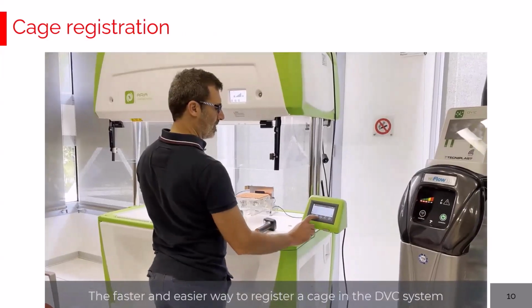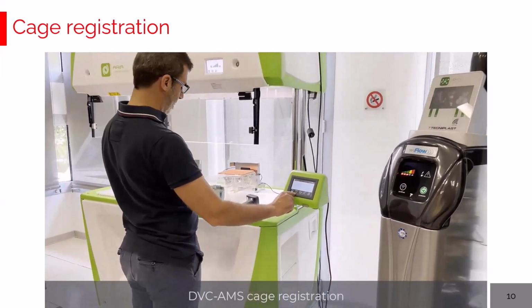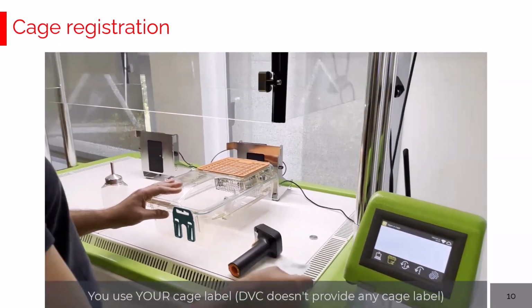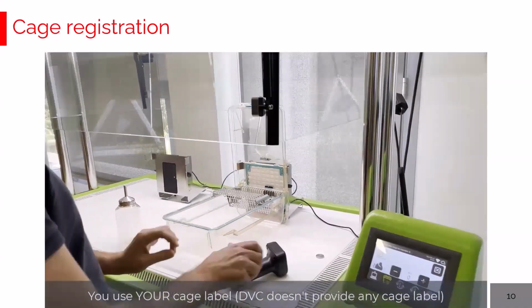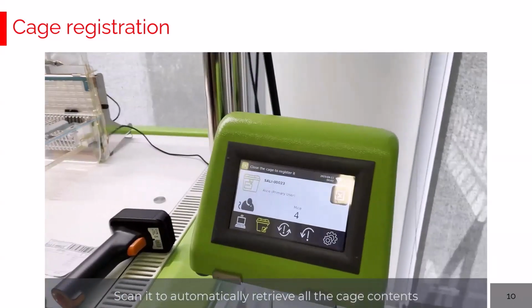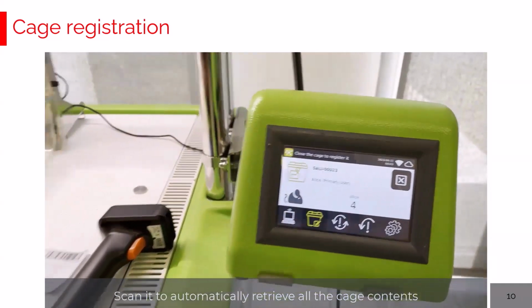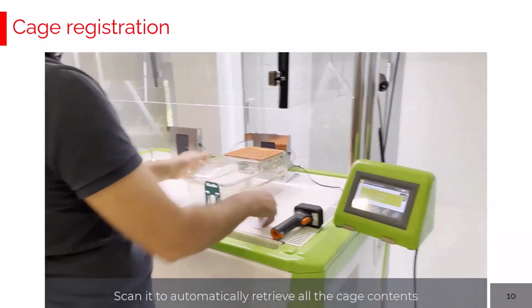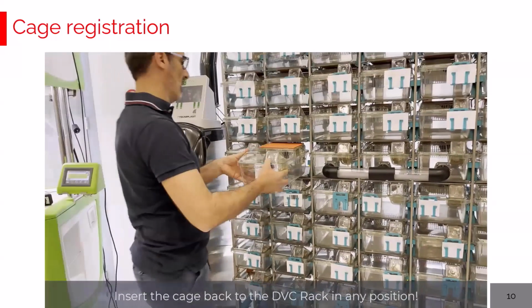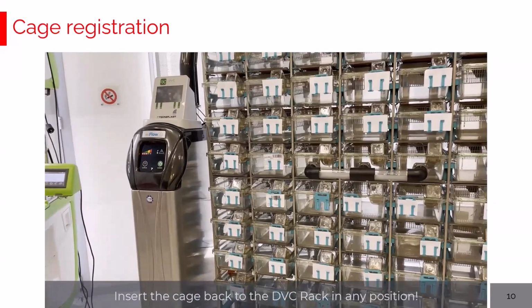Now let's see the last, but our preferable, fourth way of registering a cage. In case there is an AMS integration in place, you can simply use the control panel by clicking the corresponding icon, using your AMS cage label. You open the cage as usual, it appears. You can directly scan and retrieve all the necessary information from your AMS cage label: the cage ID, the number of animals, but also the owner, the protocol, the sex, the strain, the date of birth are completely retrieved. Simply by closing, the cage has been quickly registered and can now be inserted directly into the DVC rack into any position. Please check the red light to be sure that the rack completely reads the cage.